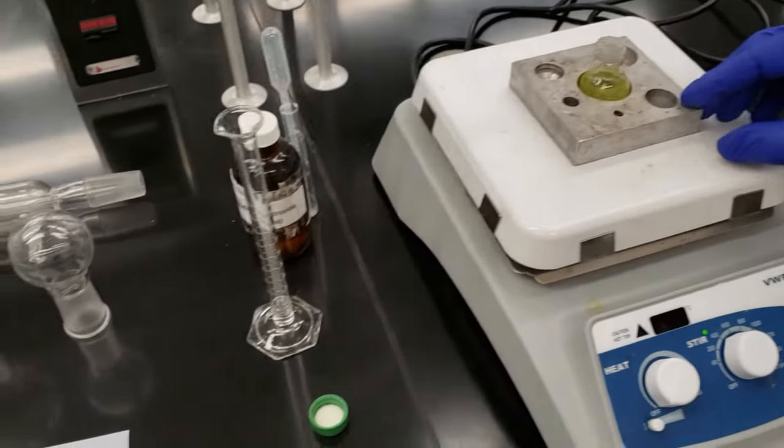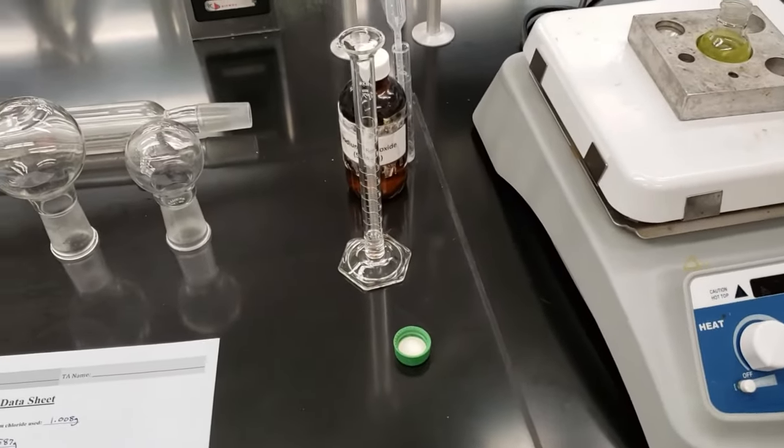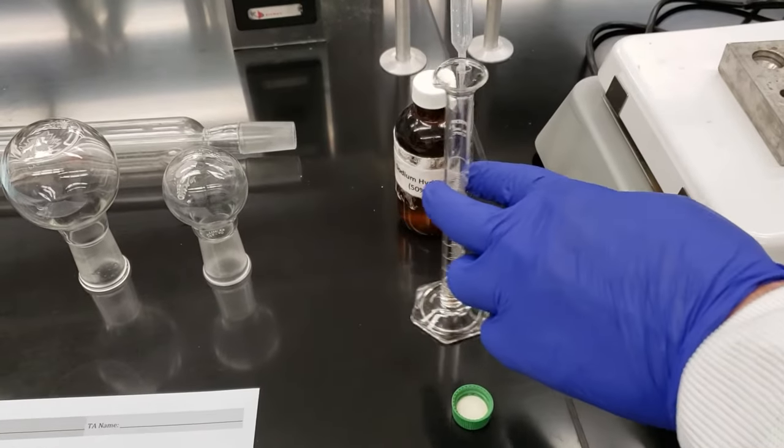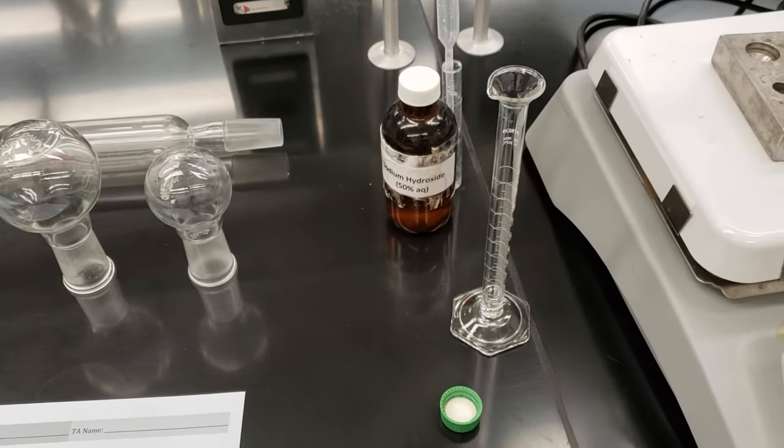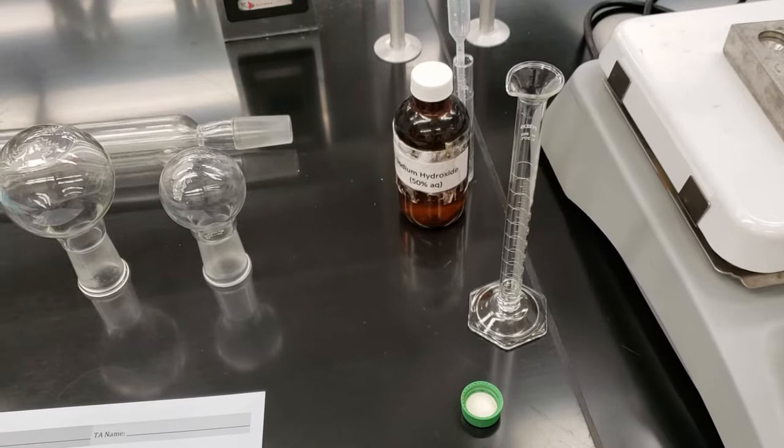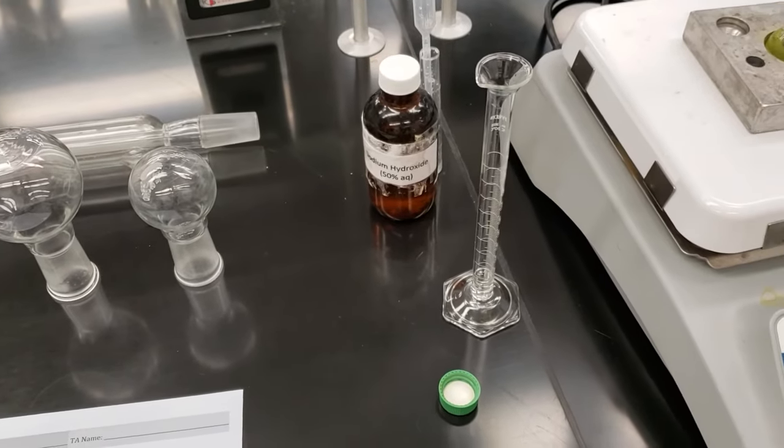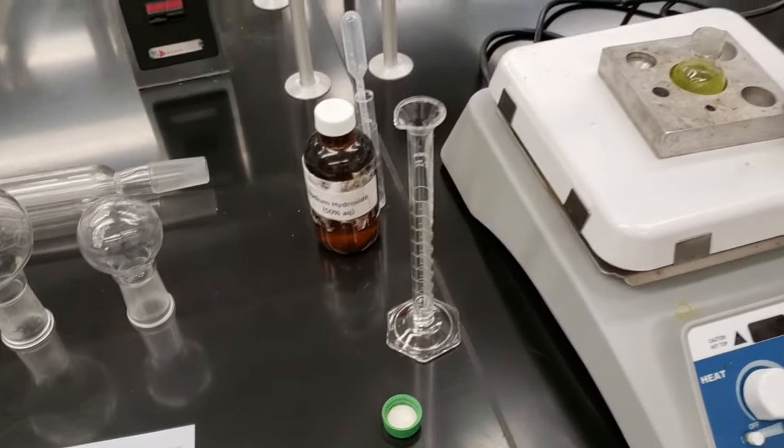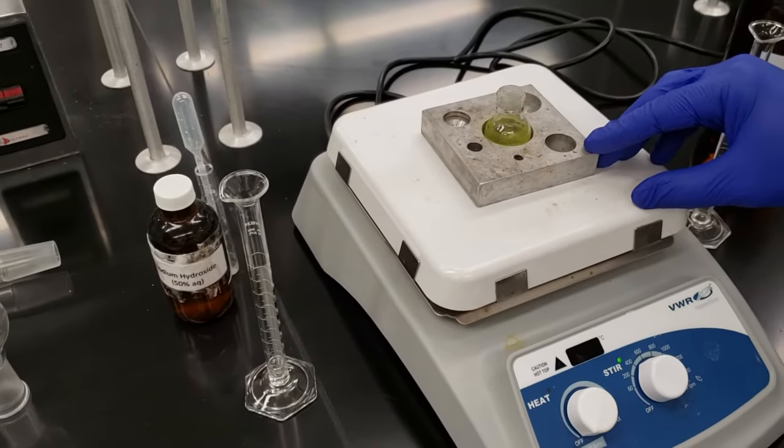Over the course of the next three minutes, I'm going to add dropwise our sodium hydroxide solution, 50% aqueous. I'm going to do that off camera. And then once we get finished with that addition, we're going to let this whole mixture stir at room temperature for 30 minutes.